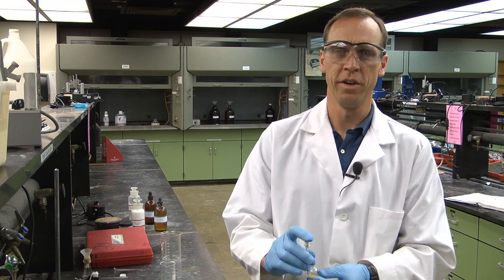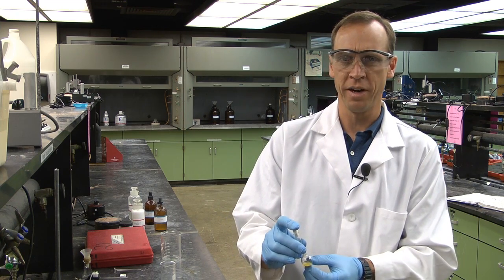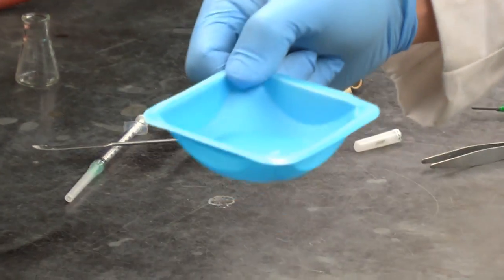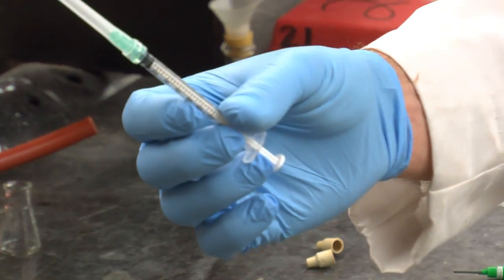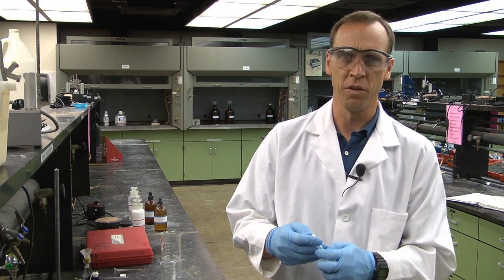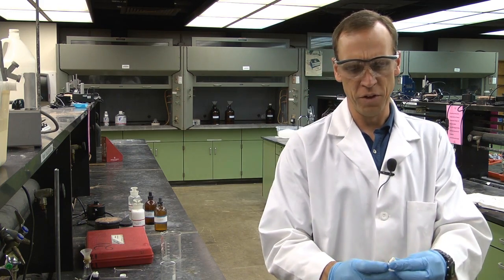I've gone ahead and I've measured out all the reagents for this experiment. With the phthalic anhydride and the aluminum chloride, I measured them into a boat like this, and I've transferred it into the round bottom flask. The toluene, I tared the syringe, then I measured the toluene into the syringe and then transferred it directly into my round bottom flask rather than the 10 by 100 millimeter reaction tubes. Okay, now I'm going to fit it with the septum.